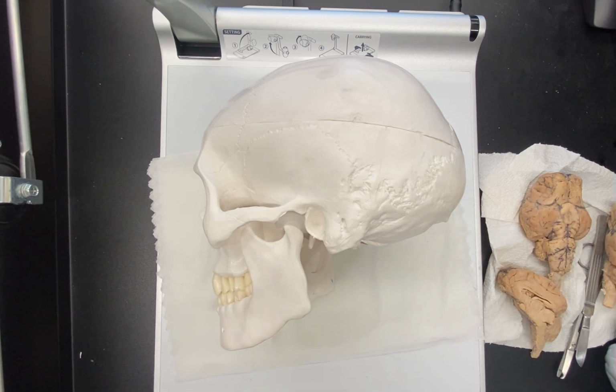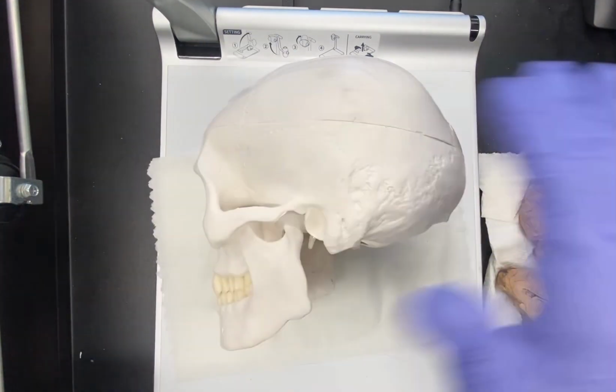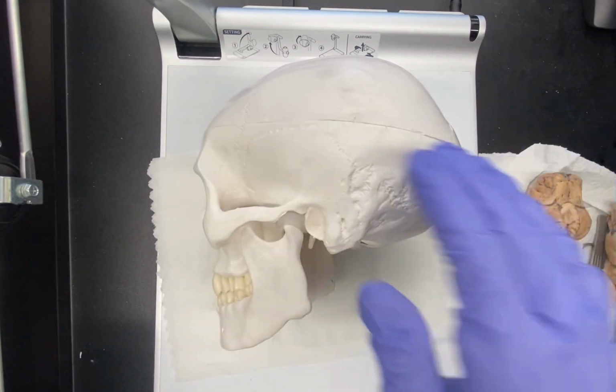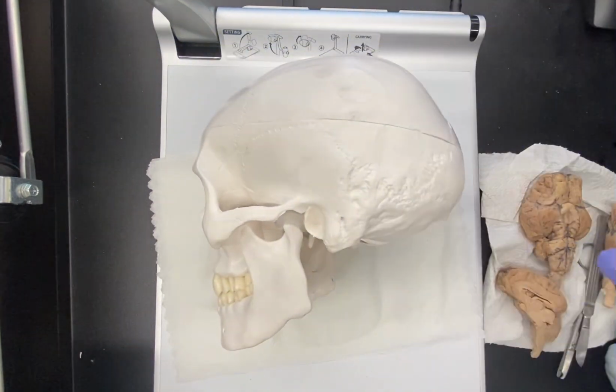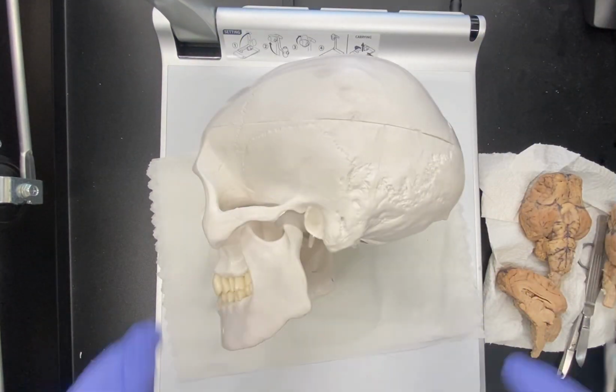But in this case, our vertebral canal and spinal cord is oriented more vertically, right? So just think of a human standing up. It's more vertically oriented as opposed to, say, your dog or your cat or a horse. Whenever you pet the back of a dog, a cat, a horse, or any other four-legged animal, that's the plane its spinal cord and vertebral column is running. It's in that horizontal plane, as opposed to humans, which is more vertical.